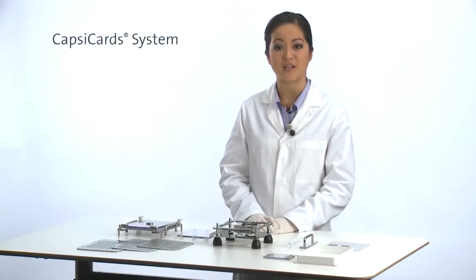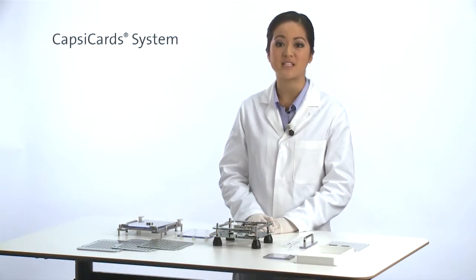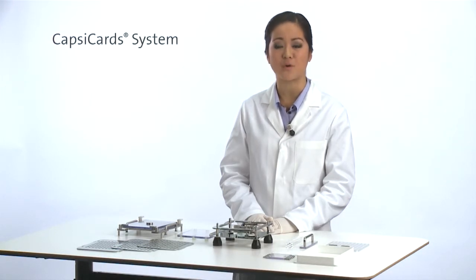Filler change parts are available in capsule size 00 to size 4. The filler base kit is the base of each CapsiCards machine. It is compatible with filler change parts of all capsule sizes.